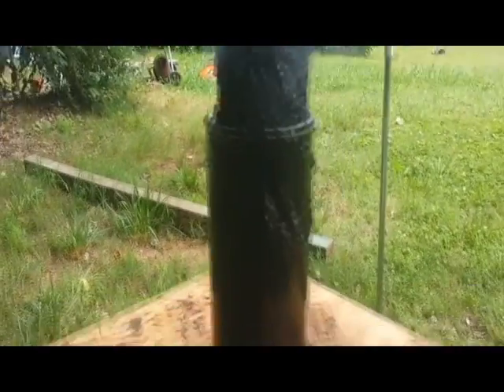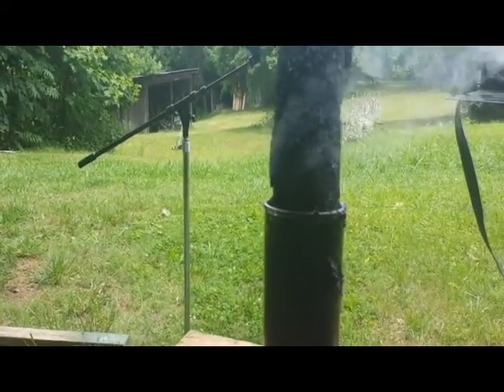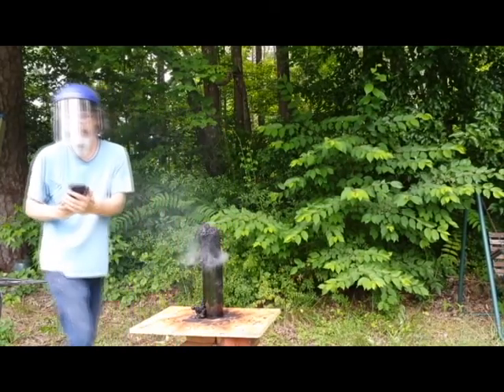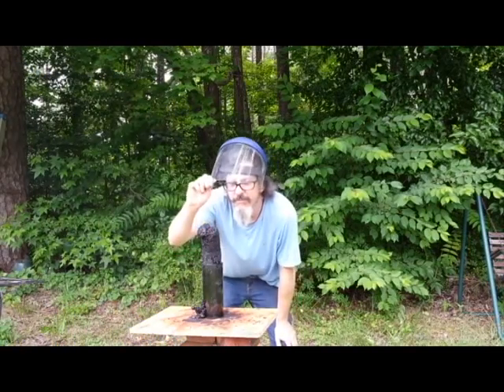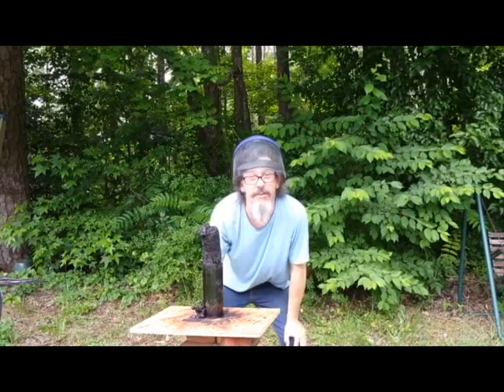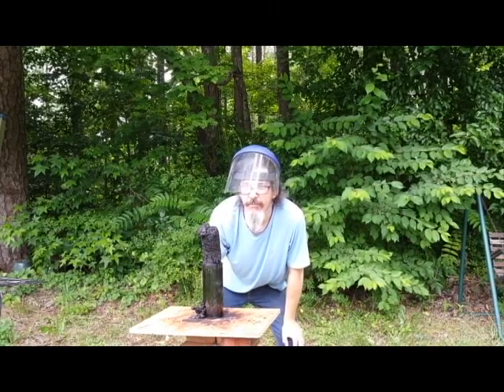The reaction has definitely slowed down now. That glass is hot to the touch — a lot of heat. It smells like burned sugar. Well, I think that experiment was a rounding success. Pretty awesome.